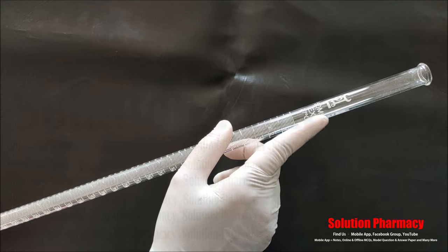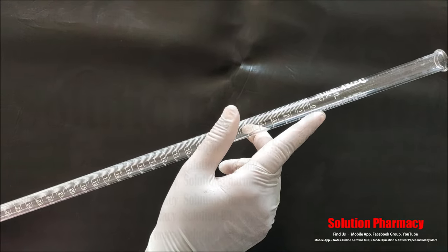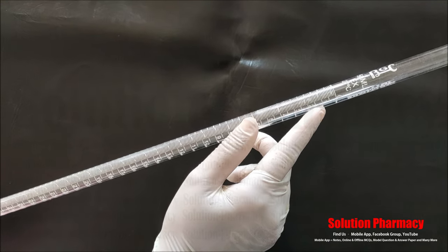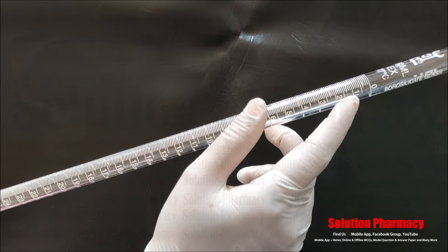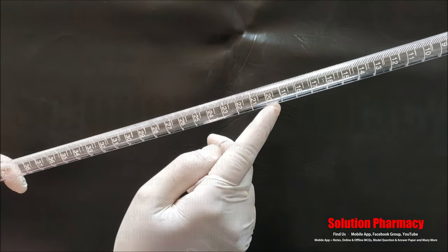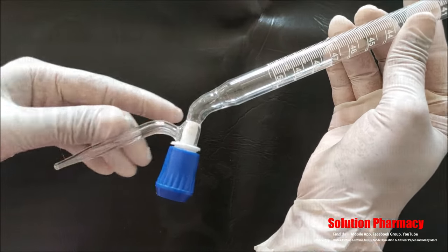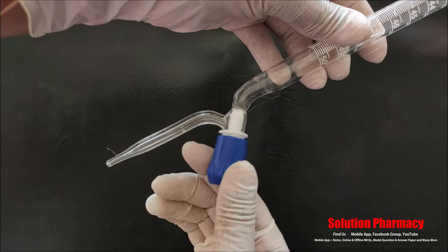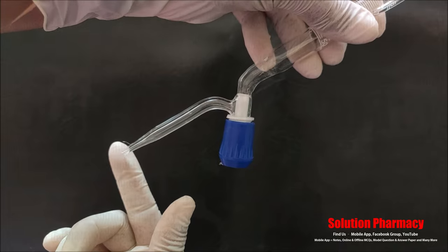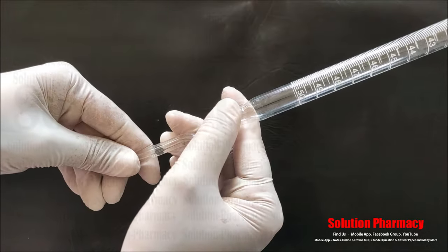Next, this glassware is called a burette. This is a 50 ml borosilicate glass burette. You can see the zero marking at the top, and the divisions go 0, 1, 2, 3, 4 — every division is 0.1 ml — down to the last marking of 50 ml. You can see there is a knob at the bottom which we can open and close to allow liquid to come out drop by drop. We use the burette for different types of titration.